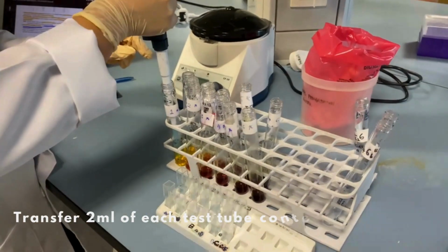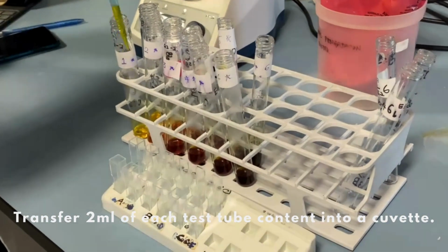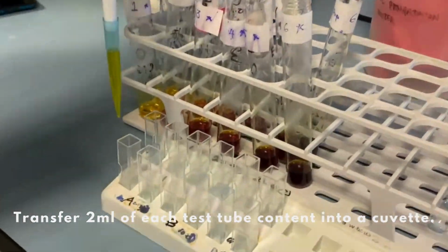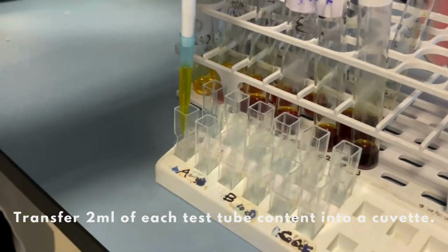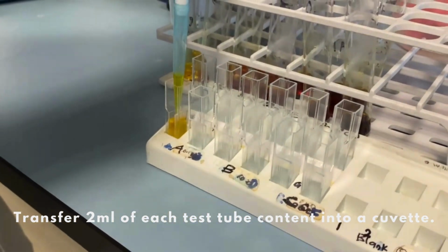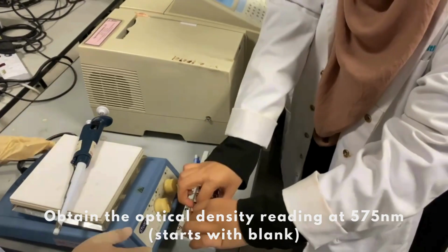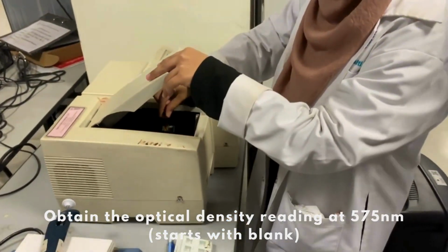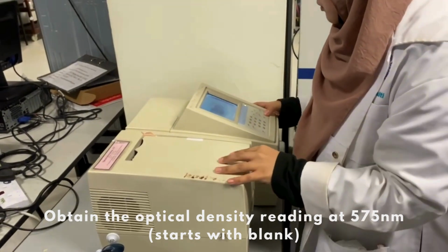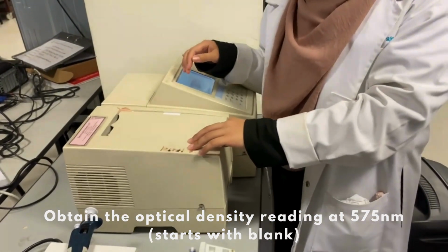Transfer 2 ml of each solution into a cuvette. Obtain the optical density reading at 575 nanometer using a spectrophotometer. Remember to start with blank.